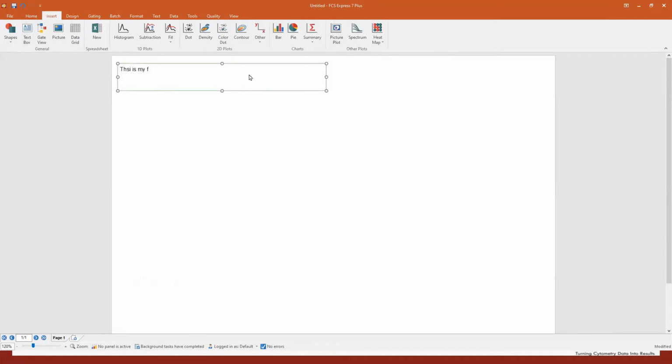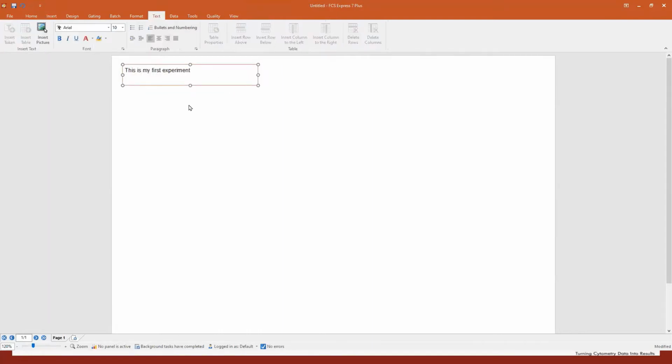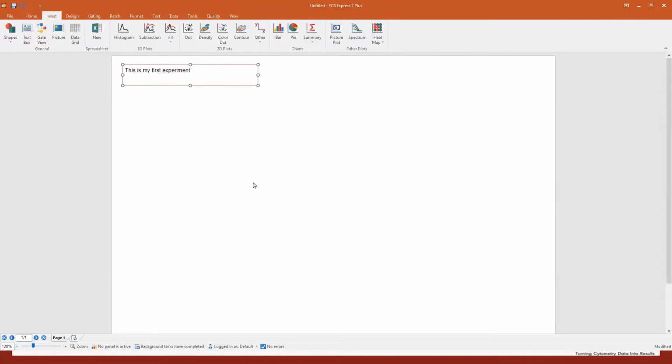This is my first experiment. This text box can be resized, can be moved around. We also have a text tab. You can change the font, the size, all the basic word editor options are there. Then you can also, of course, insert other objects. You can insert shapes, you can insert the gate hierarchy, you can insert a picture, maybe the logo of your company, your institution, or your university. We have an integrated spreadsheet that allows you to make calculations. It's the same spreadsheet that we saw in the example before. And you have access to all the plots that you want.